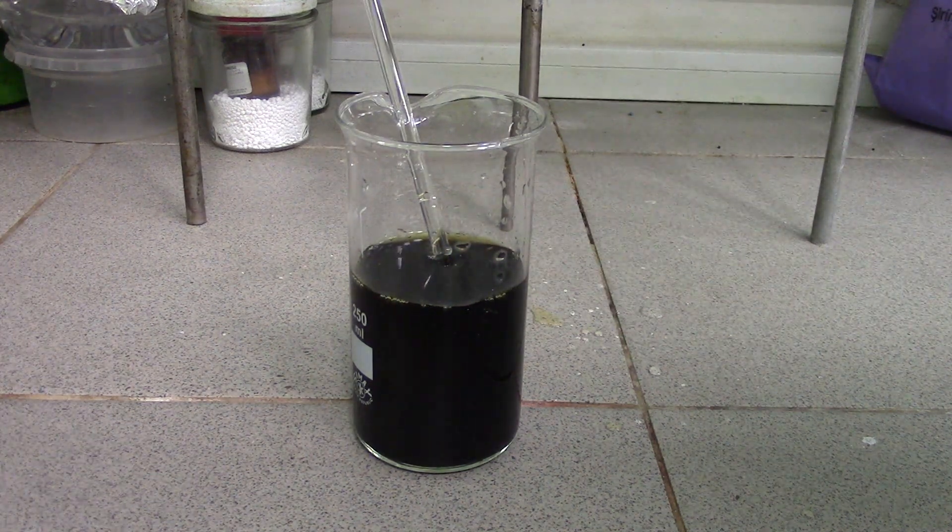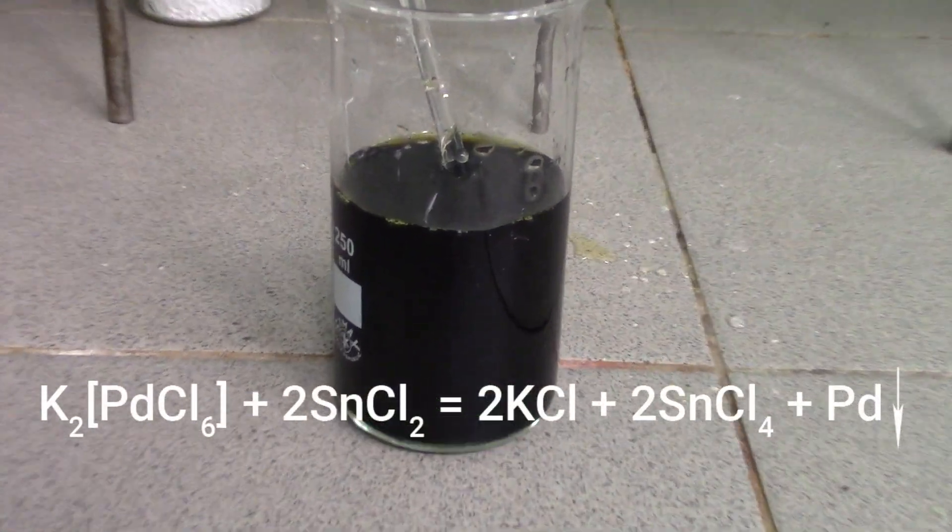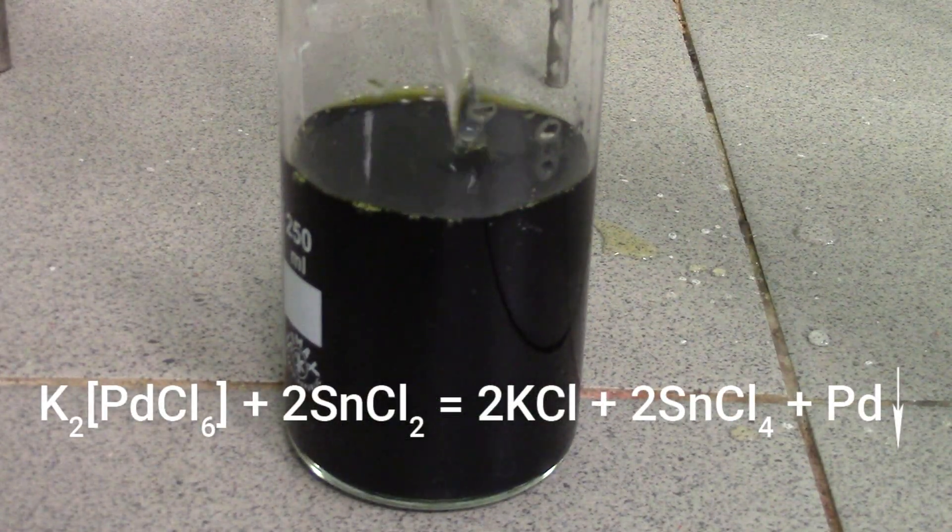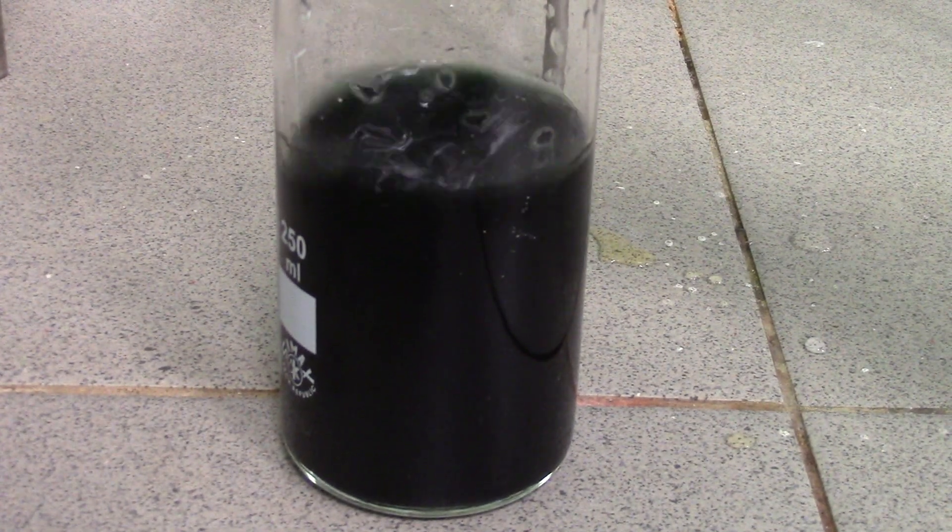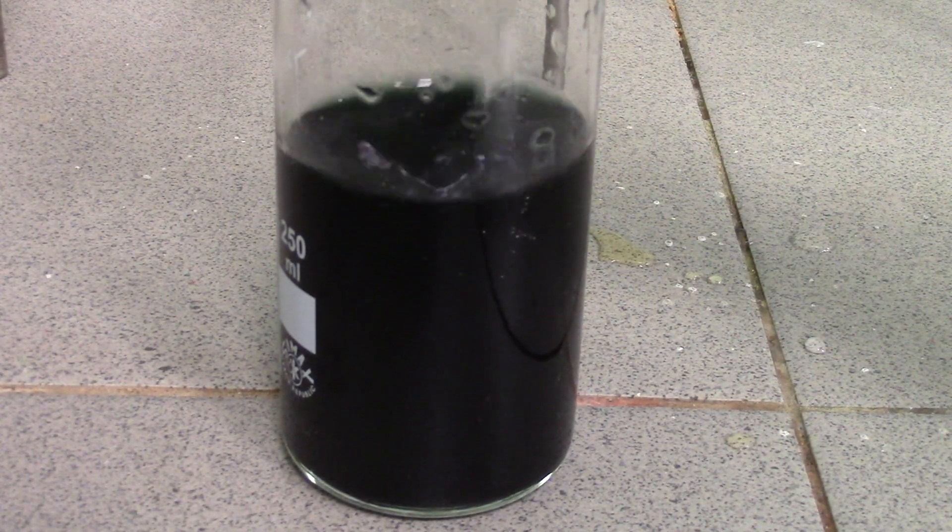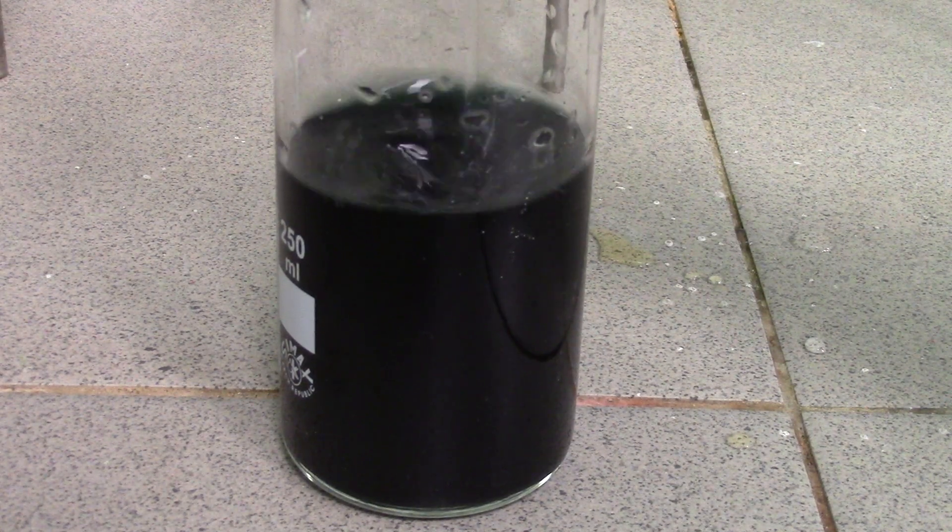Did you see it? In this reaction, tin 2+ ions reduce the palladium into palladium black. Likewise, you can see a nice green color of solution associated with the formation of palladium nanoparticles. By the way, for gold that color is purple.